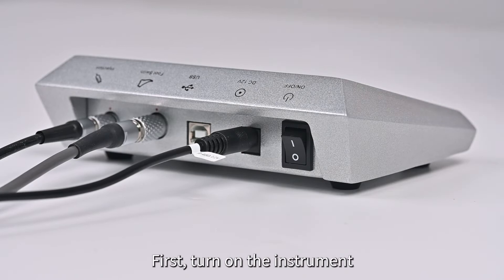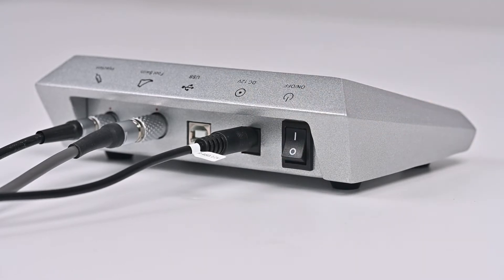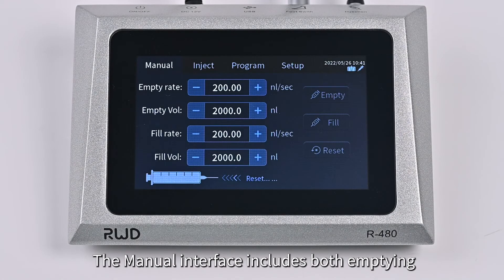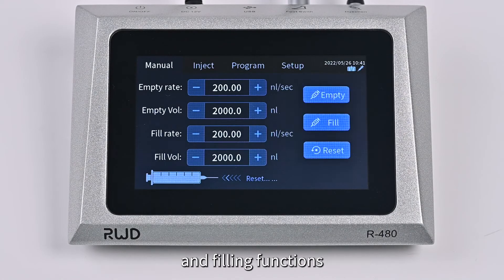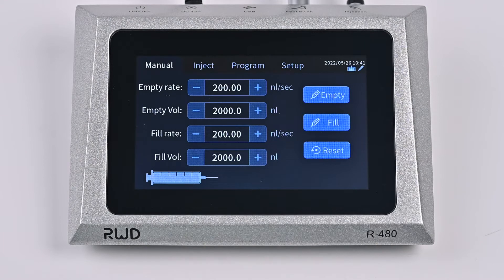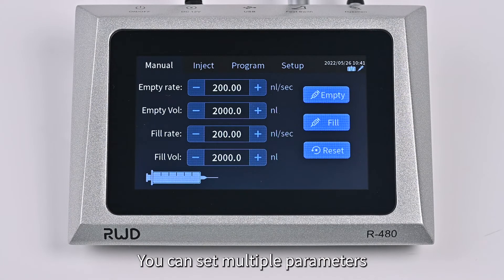First, turn on the instrument. The manual interface includes both emptying and filling functions. You can set multiple parameters.